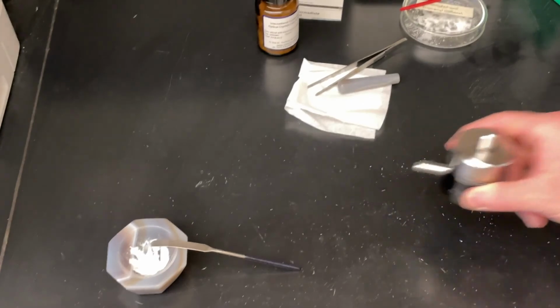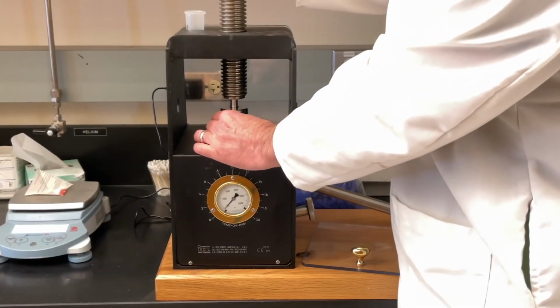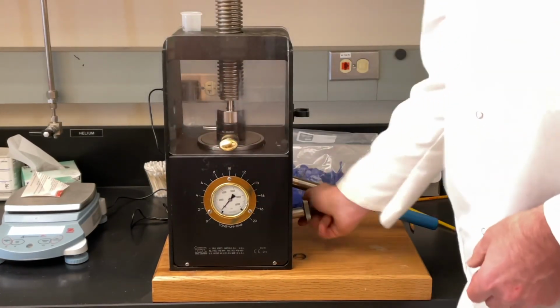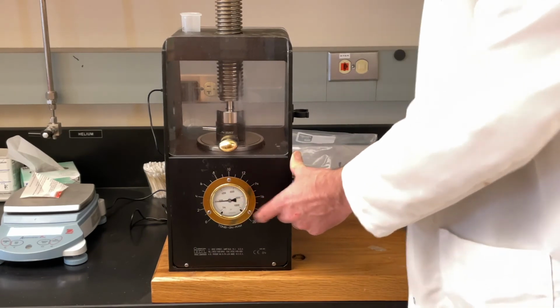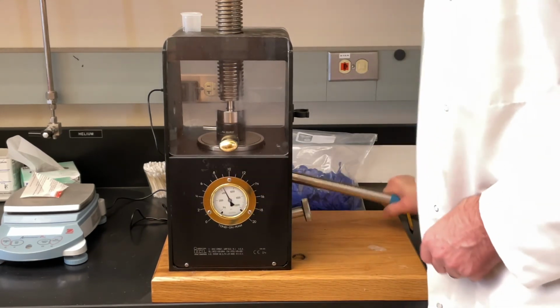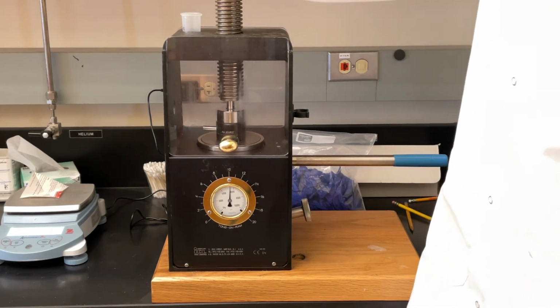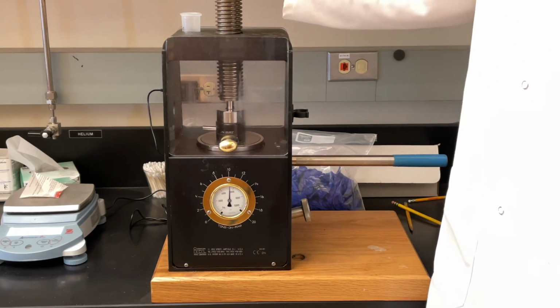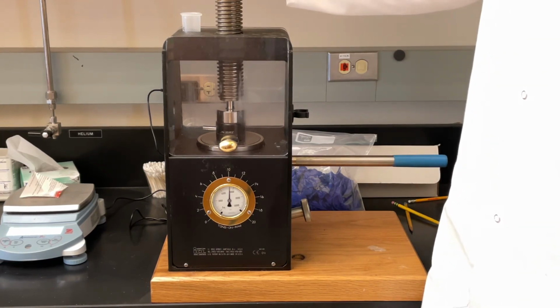Let's see if I can show you that press. Okay, here's the press. The body goes inside here. Once that goes inside, we have a protective shield that goes over the front, hydraulic lock. You can see the pressure that we're applying here. On the outside of this ring it says tons on ram. We take it up to 10 tons. So this is 10 tons applied onto that piece that is now pressing that powder, fusing it back into a pellet. We let it sit there for about 30 seconds.